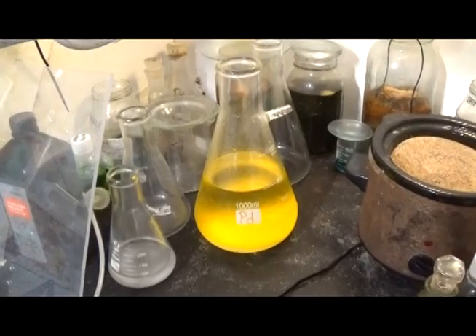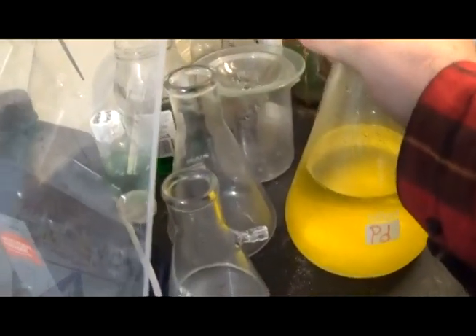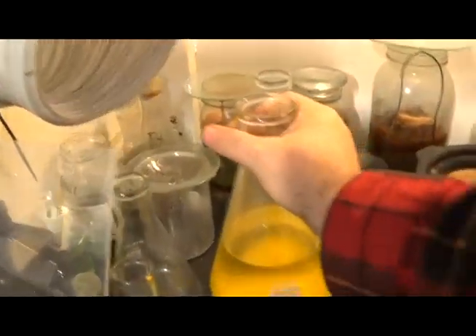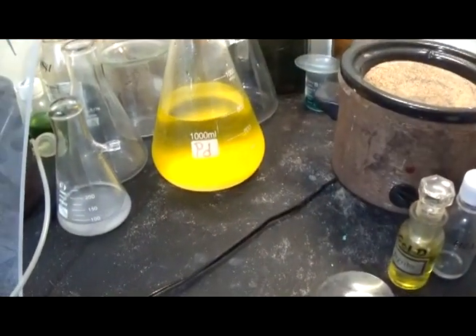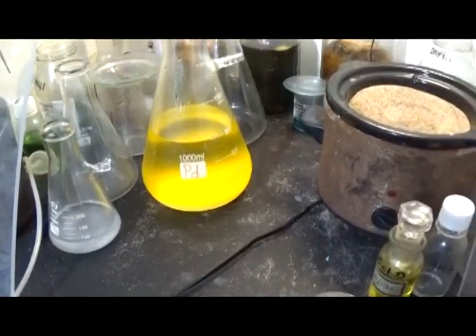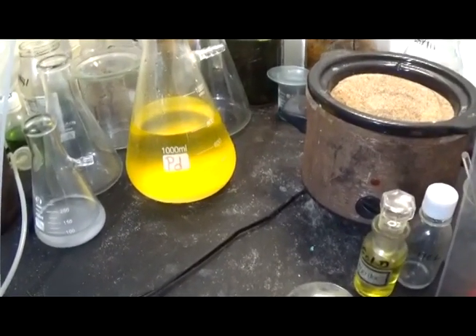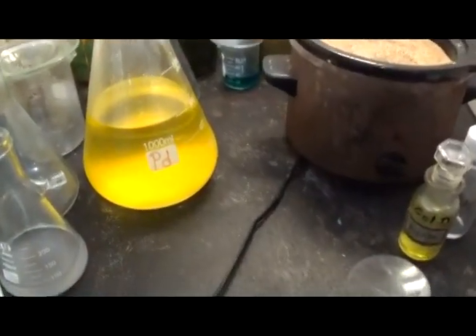Okay, part two of this abomination. Well, most of this I've given a couple days to settle out. It's not as clear as I like it, but it's pretty clear. Most of the tin chloride, or what I think it is, has settled out in the bottom of this flask. So we're going to triple filter it again. And maybe, just maybe, we can filter out the rest of this and get onto the SMB.